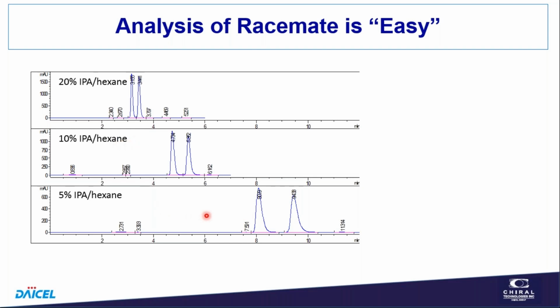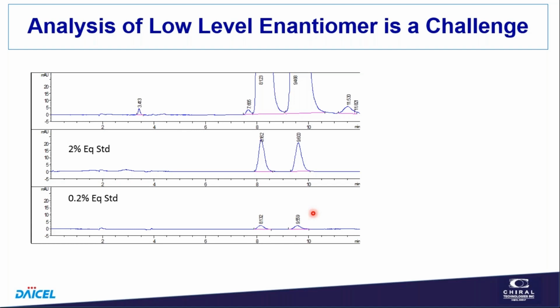This is fairly straightforward. Notice that we get a little more tailing. Notice the peaks are a little shorter. Part of this, I think, is a little bit of column overload. I had shot a very concentrated sample just because I didn't know how much response I was going to get. So the analysis of the low-level enantiomer is a bit of a challenge. And for this pair, we got nearly baseline separation.